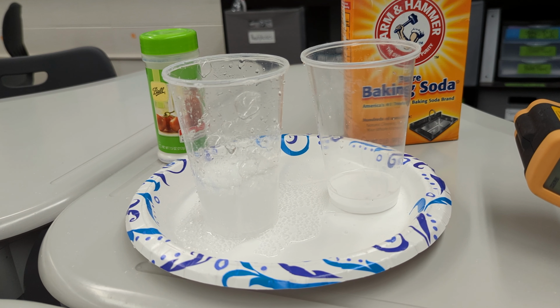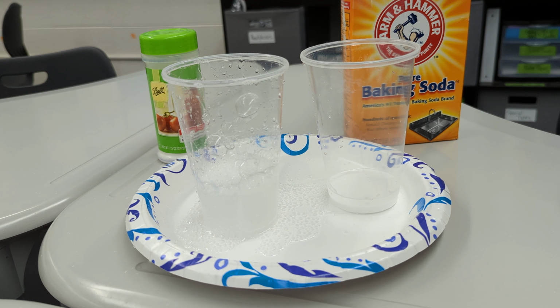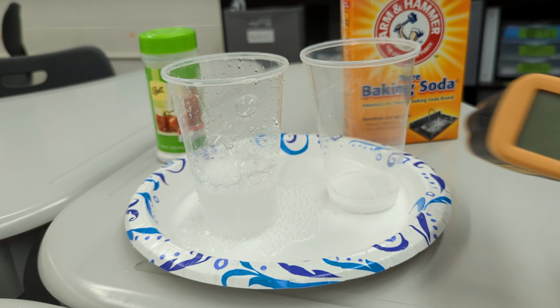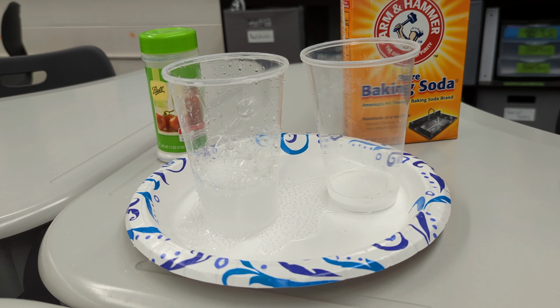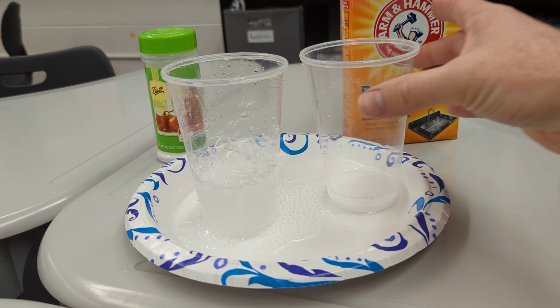Now remember, I'm not measuring the actual thermal energy inside those bonds. I'm measuring atmospheric, essentially. I'm measuring the energy that is now radiating. So it is now radiating off less thermal energy than it was before.